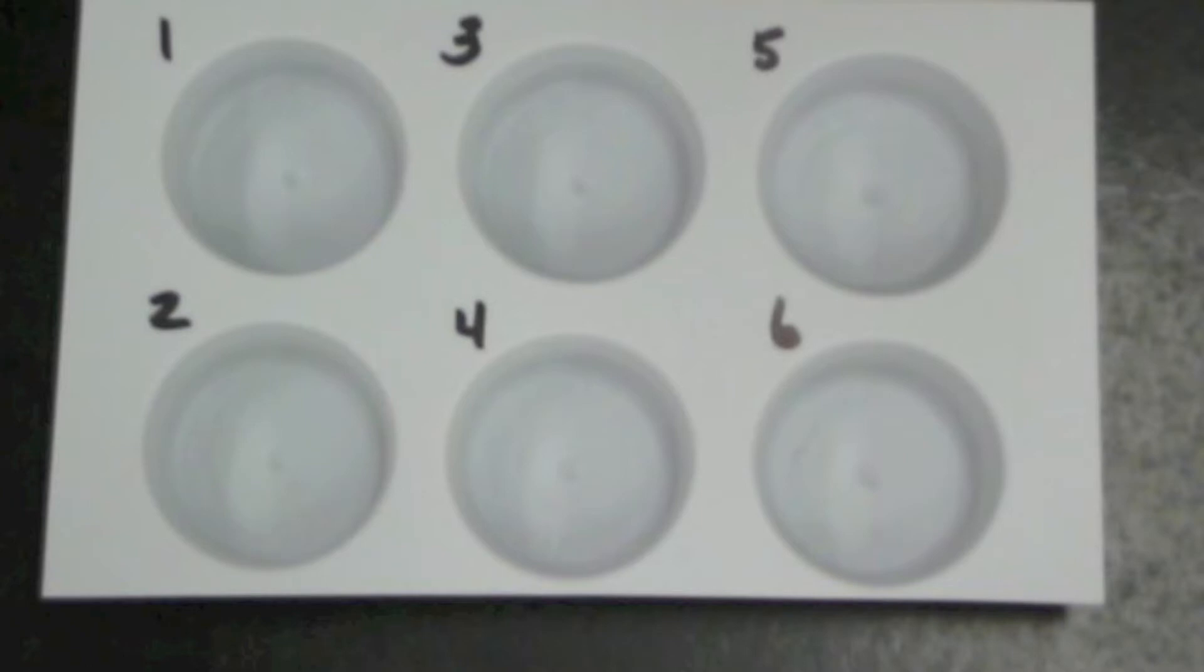In this lab we'll be testing liquids for protein. Our test material is going to be a Coomassie blue powder or protein test strip. Let's see what we need to do to complete this lab.